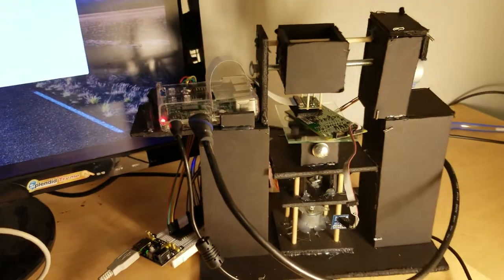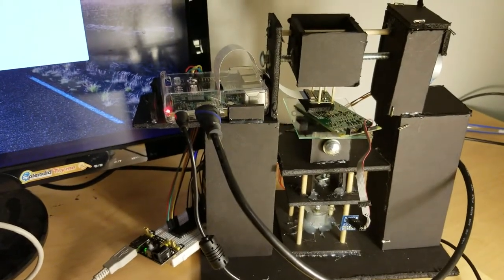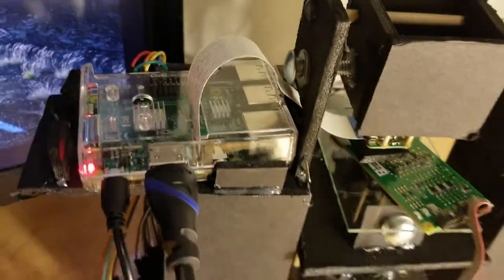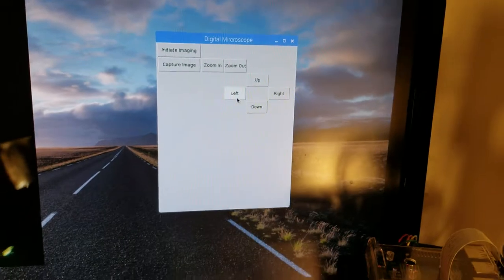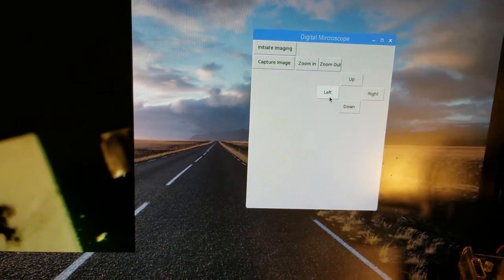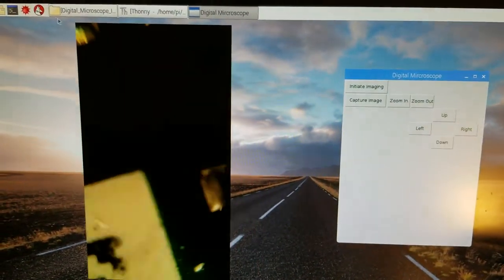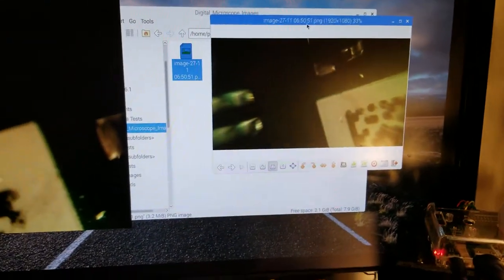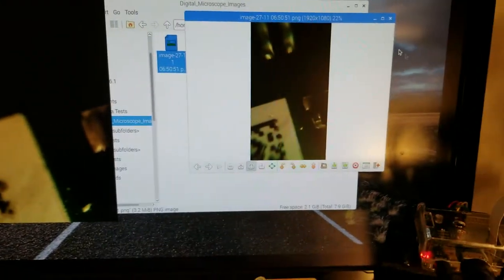Alrighty, so a bit more into how this all works. The setup, as I explained earlier, is made of servos that determine how the object we're observing is going to move in three axes of direction. The Raspberry Pi here that's being displayed, I programmed using Python an interface for the user, which simplifies everything down to just a few button clicks. For example, if we want to capture an image, I can click capture image, give it a moment, and then I can open it up here. And we have our captured image, although it's slightly rotated.